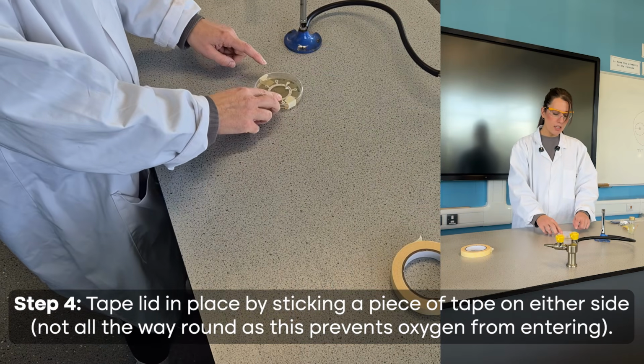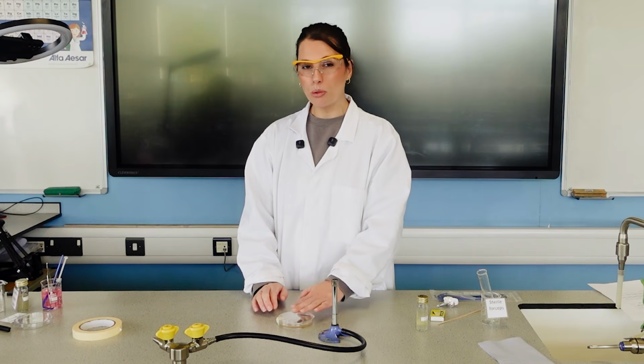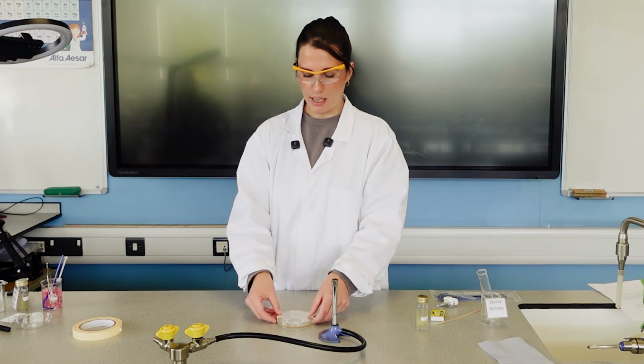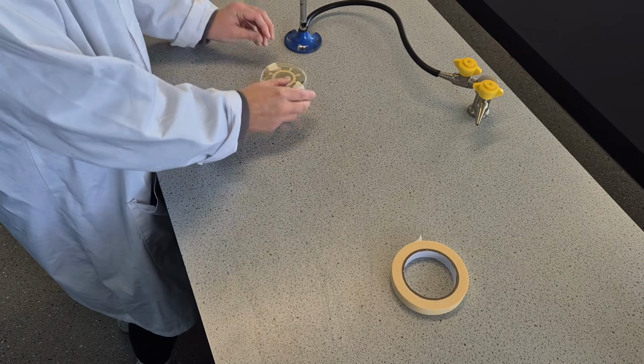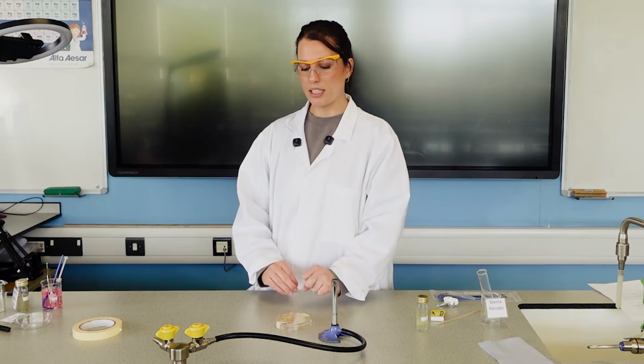Now, sometimes I do get the students to wait just about a minute or so before they do that, because it is still quite wet in there and everything might just fall upside down. But let's give it a go. Okay, so we've left it long enough. It is now all staying on the top. The dish has stayed there as well.